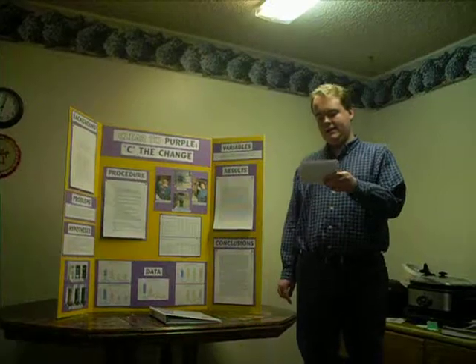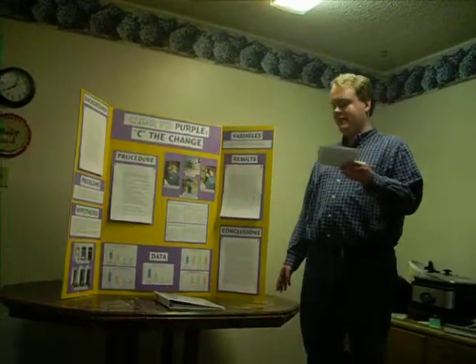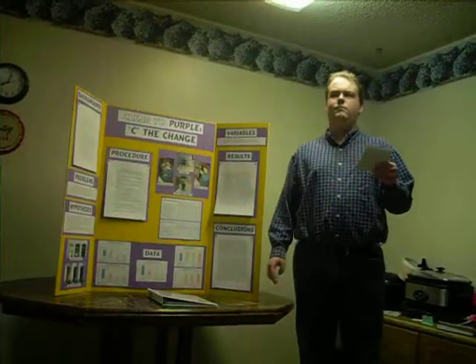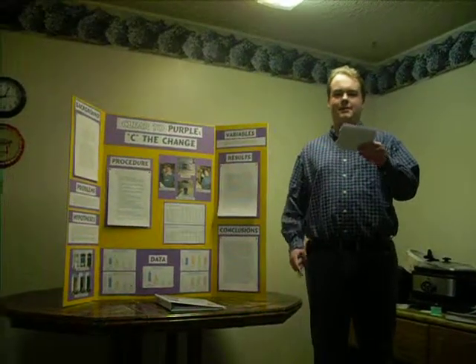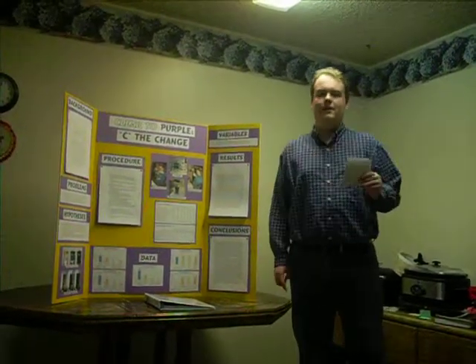There's several examples of these: the formaldehyde clock reaction, the thiosulfate clock reaction, the vitamin C clock reaction, and many others. So the last two in particular are what you commonly see. They both are basically the same reaction. The vitamin C one just substitutes vitamin C for thiosulfate, as vitamin C is a much more economical and common substance. The oscillating reactions, on the other hand, are a bit different.